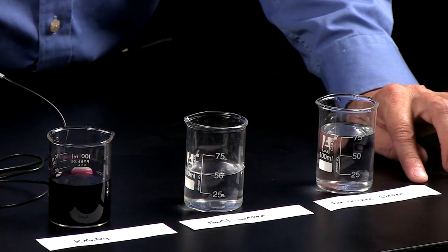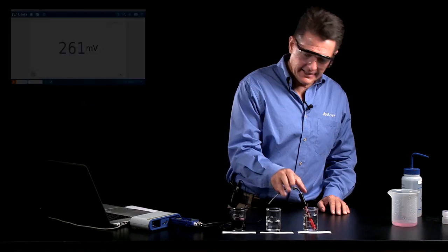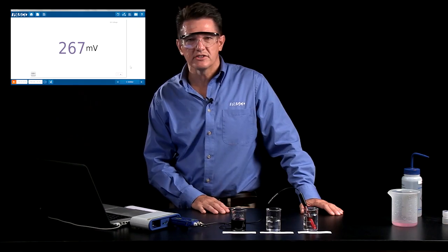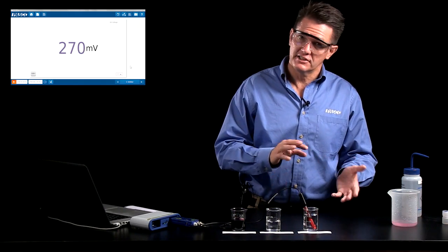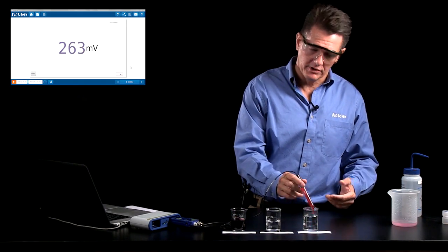I do have three solutions. The first one is deionized water. Placing it in there, I get a reading of about 266. That means it's not very oxidizing or reducing, as you'd expect deionized water to be.